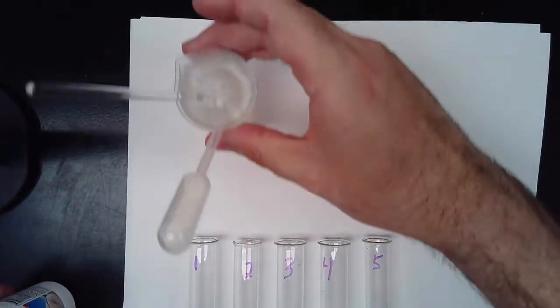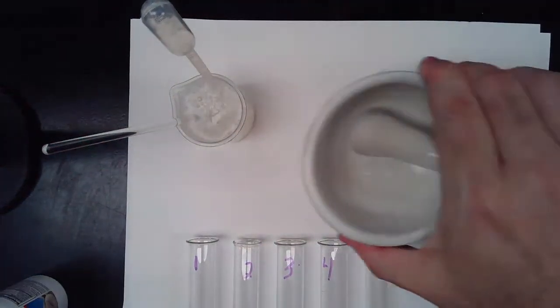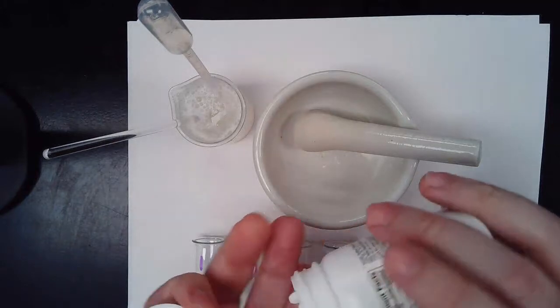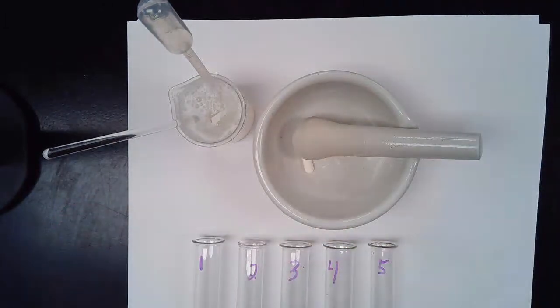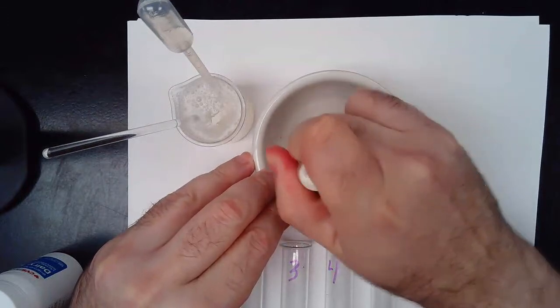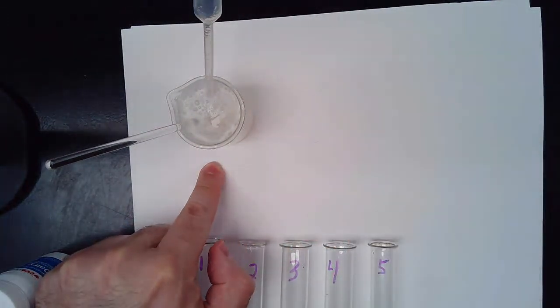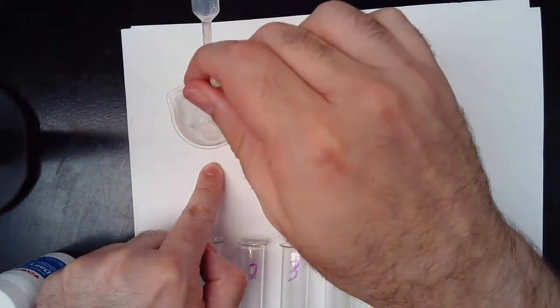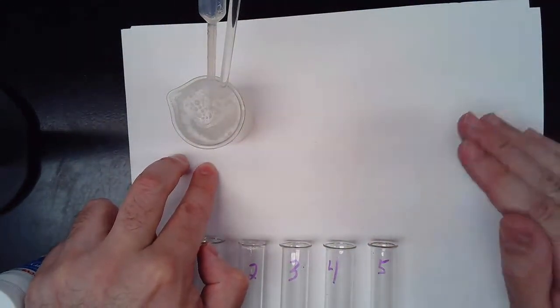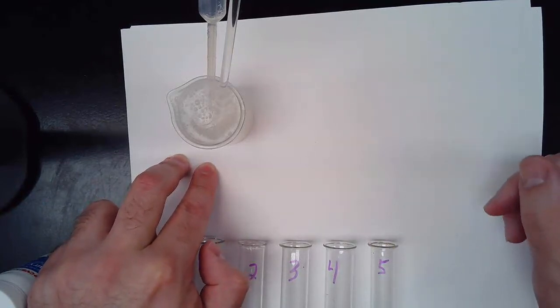What I've done is take that lactase enzyme and crush it up into a fine powder. All we did was take one of these tablets, toss it in our mortar and pestle, give it a bit of a grind, reduce it into a powder, add it into our beaker with some water, and mix it up. It's kind of chalky looking because when they make this, they add a binder, and the binder happens to be fiber, good old cellulose.